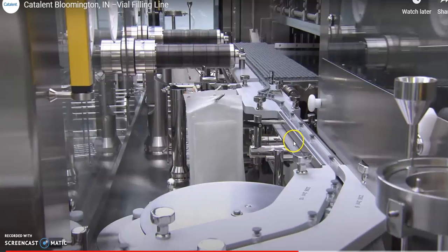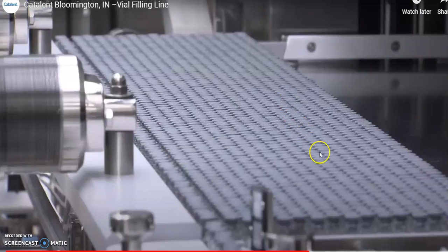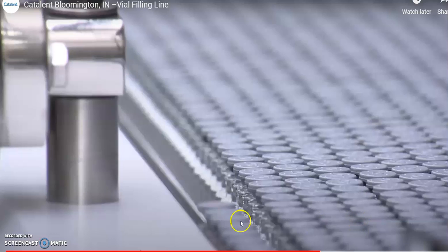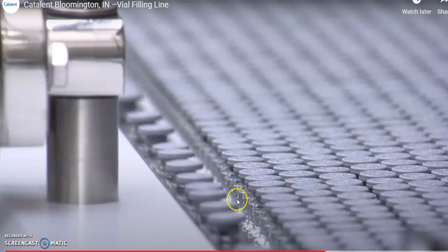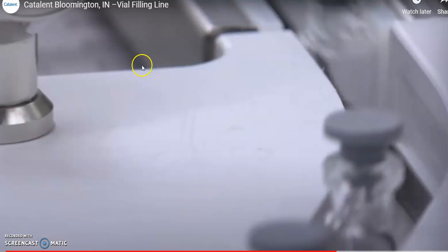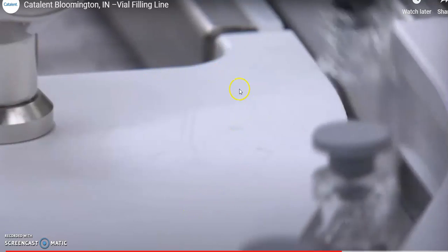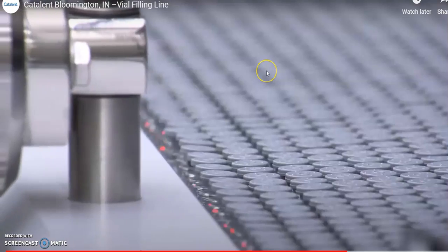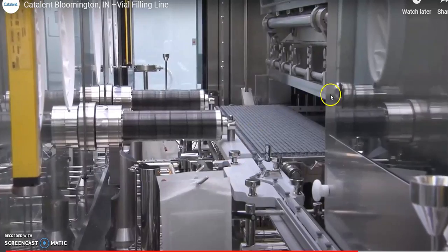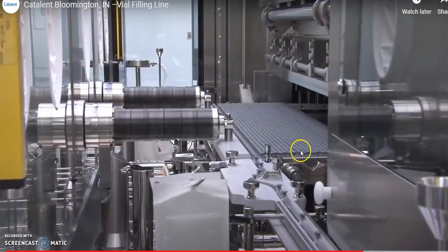Lyophilization may take place. That's freeze drying. If that's the case, rubber stoppers cannot be pushed in all the way before it can be sealed. So instead, see, they are snugly sitting on top of the vials, which gives the space where vapor can escape during the lyophilization process. It will be loaded to the freeze dryer machine automatically.